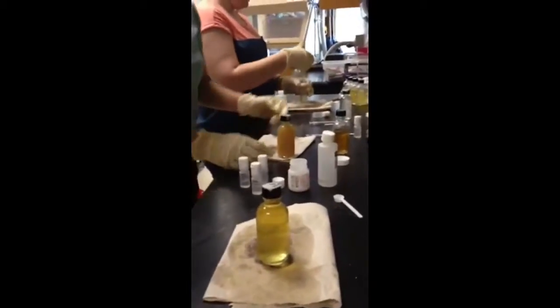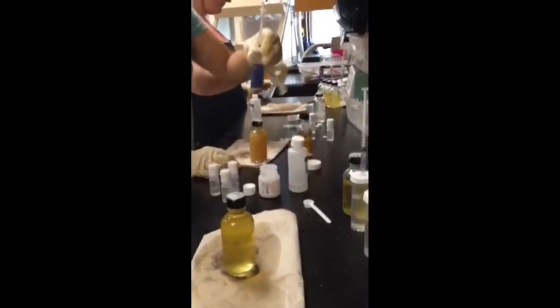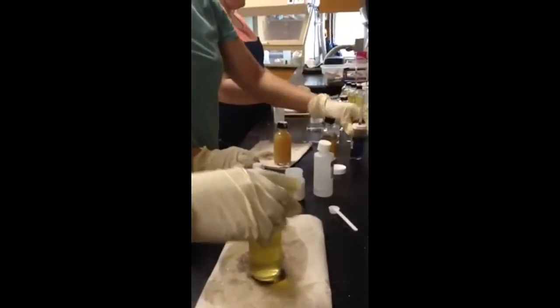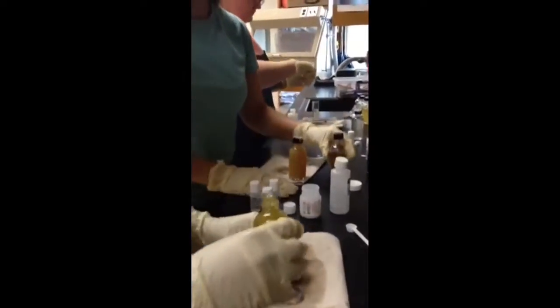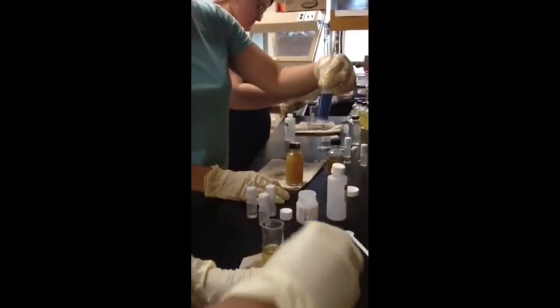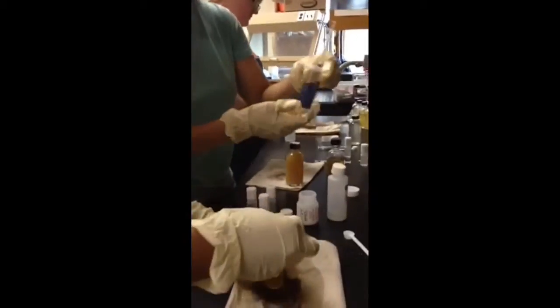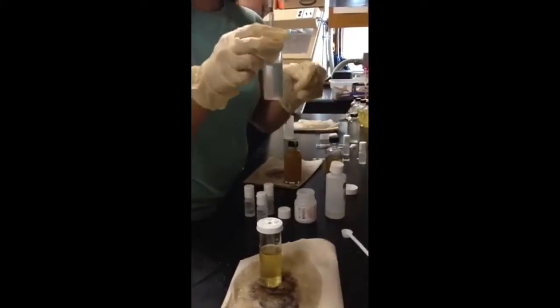You would take this and pour it into one of these bottles. And then you use thiosulfate to turn this dark color to a light yellow. Then you add starch indicator, 8 drops of it, to turn it this blue color. Then you use the rest of your however many drops it takes to turn it clear, like these. And then you're done titrating.